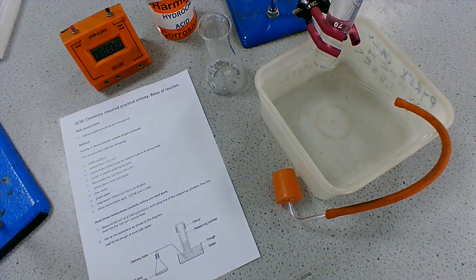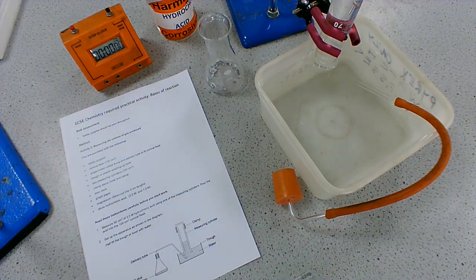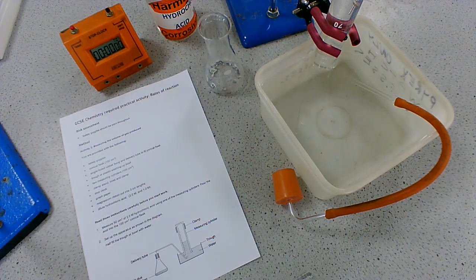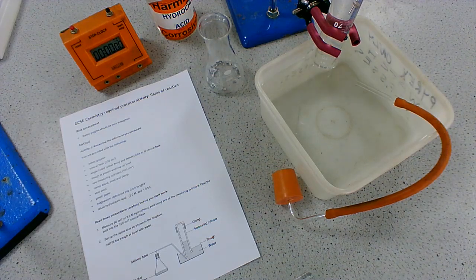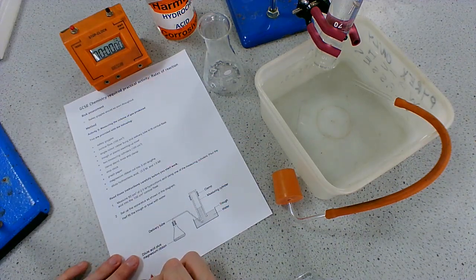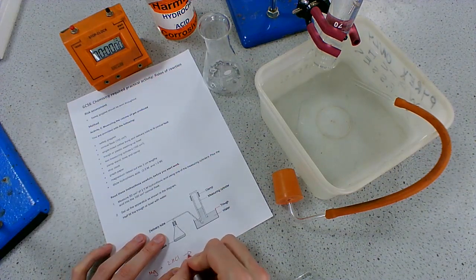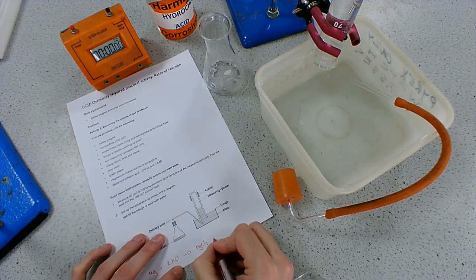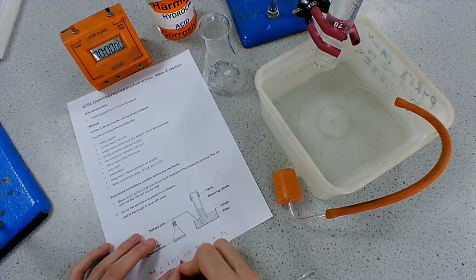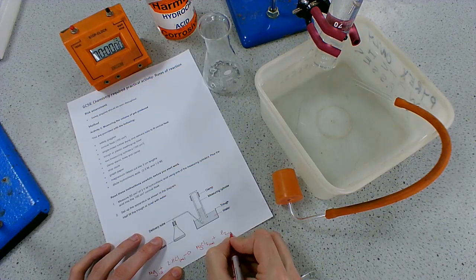This is activity two from the rate of reaction required practical, and again we're looking at the exact same thing - the effect of varying concentration on the rate of a reaction. We have a very different reaction here: the reaction between magnesium ribbon and hydrochloric acid. Magnesium plus hydrochloric acid produces magnesium chloride and hydrogen gas - solid magnesium with aqueous hydrochloric acid forming aqueous magnesium chloride and hydrogen gas.